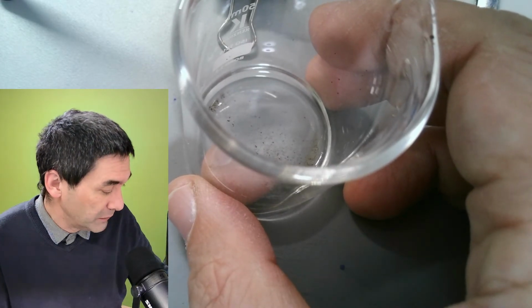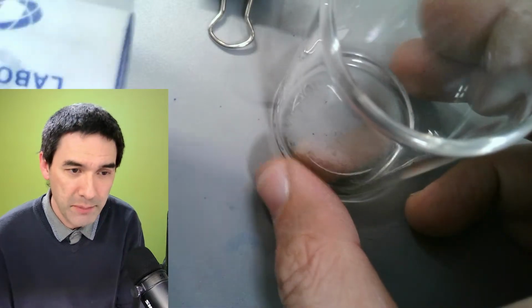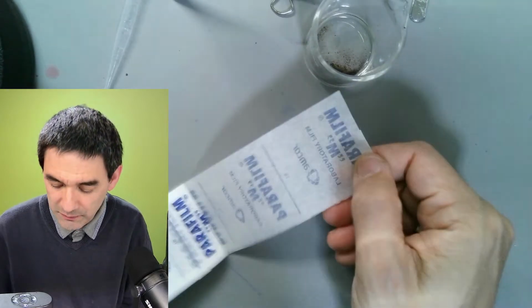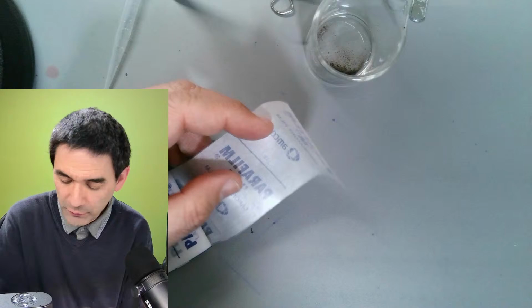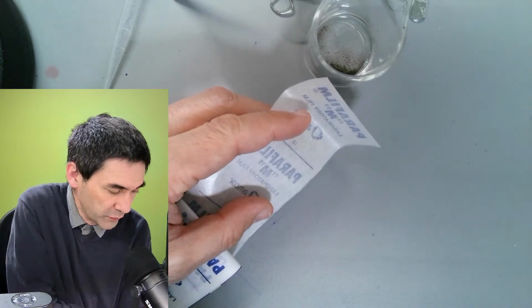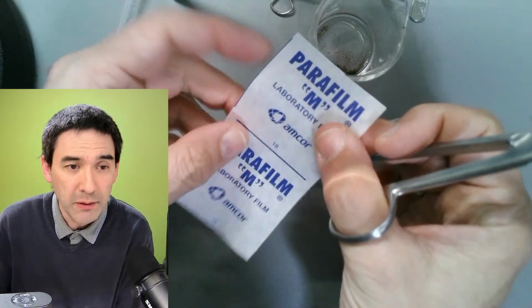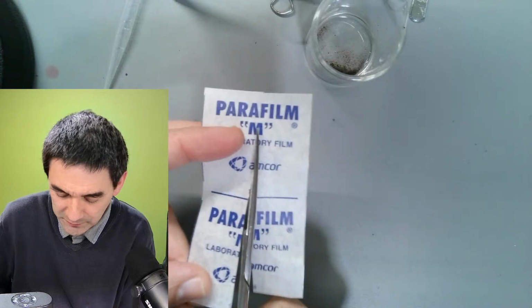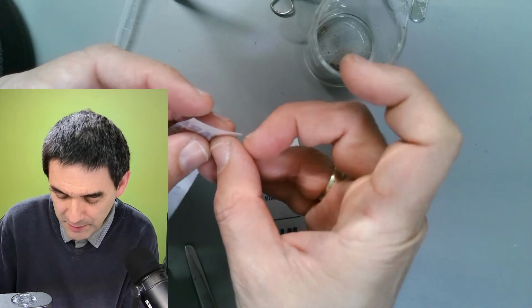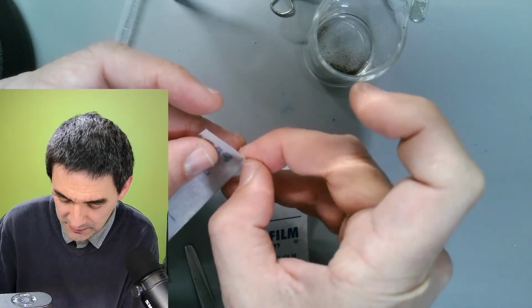I will show you what parafilm is. It's, I think, the most interesting invention ever. Yeah, so this is basically parafilm. I'll just show it to you. This parafilm can be used for a variety of different purposes. What I've done is I can just show it to you because this is really useful, and this is how I actually connected the things together. You have to cut it here so that the brand name is parafilm. Yeah, and when you do the following, you first have to separate the paper here, and then you can get watertight and also airtight seals.